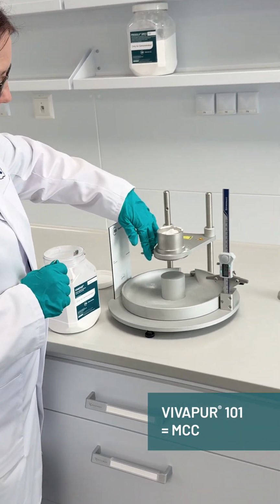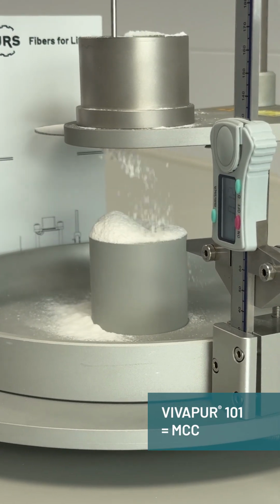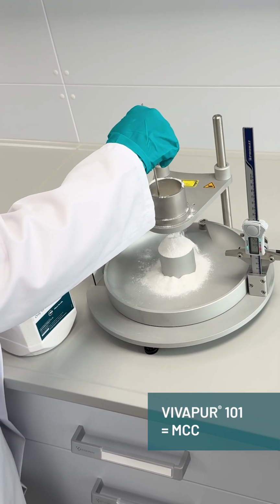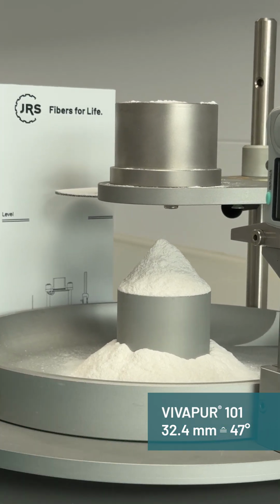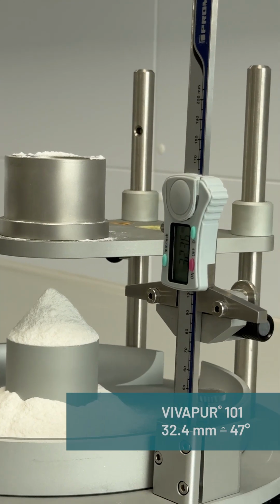And now I'm going to drop it. And you can see it looks actually a lot like flour that you might bake with. And while I can stir it and get it through the holes, it's really not flowing on its own. All right, so the height is 32.4 millimeters, and that corresponds to an angle of about 47 degrees.